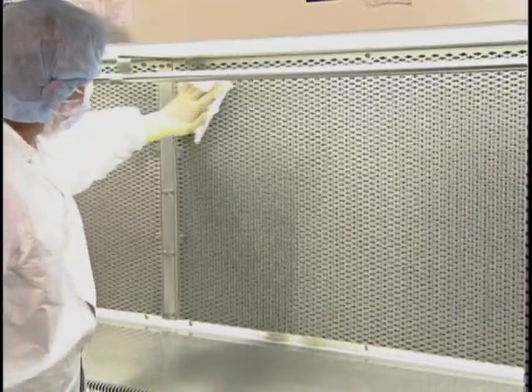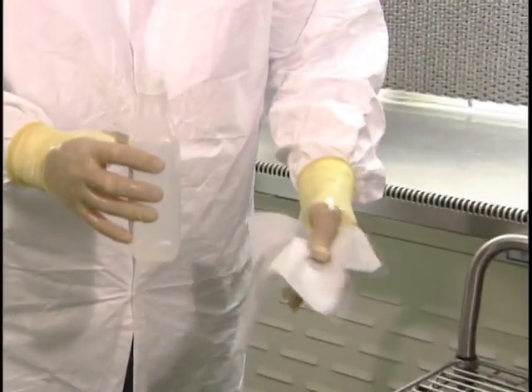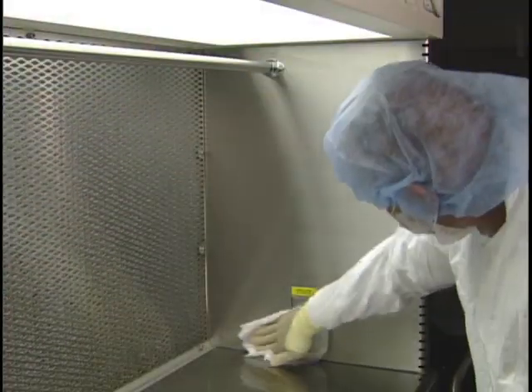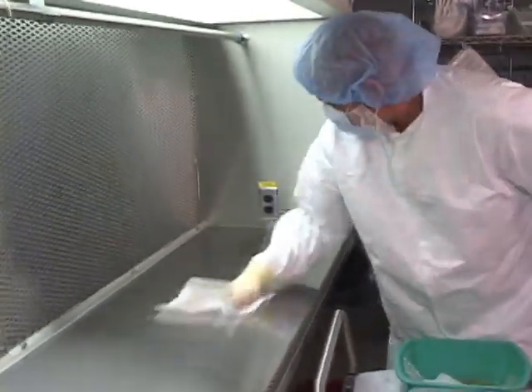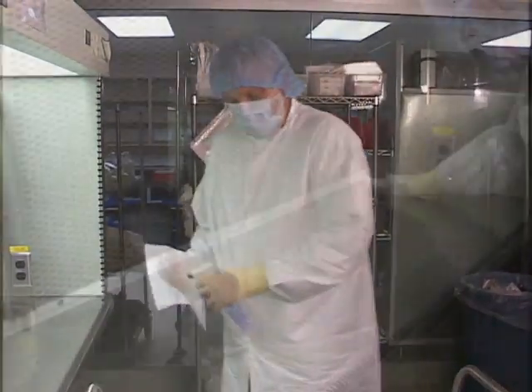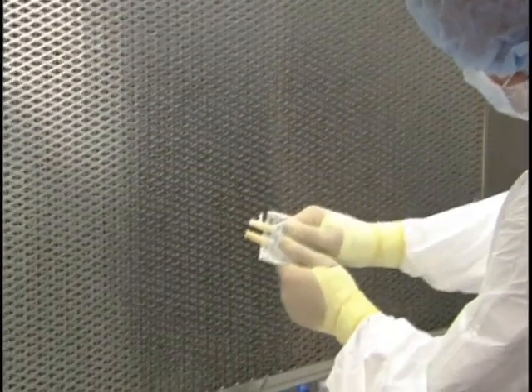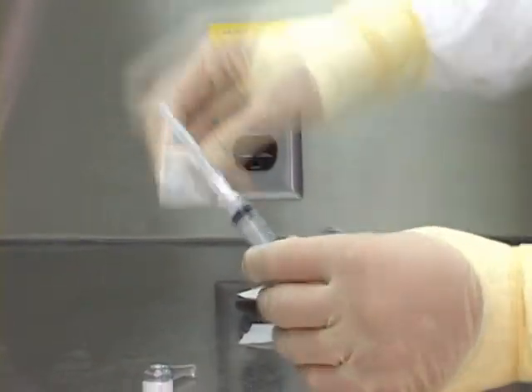Before use, all interior working surfaces of the laminar airflow workbench should be disinfected with an appropriate disinfecting agent and a clean, lint-free cloth. Cleaning should proceed in a top to bottom, back to front motion, starting at the HEPA filter to move contaminants out of the hood. The hood should be cleaned between each compounding batch and when the work surfaces become dirty. The HEPA filter grill or protective grill should be cleaned carefully in a manner that avoids getting the HEPA filter wet. Nothing should be permitted to come in contact with the HEPA filter.